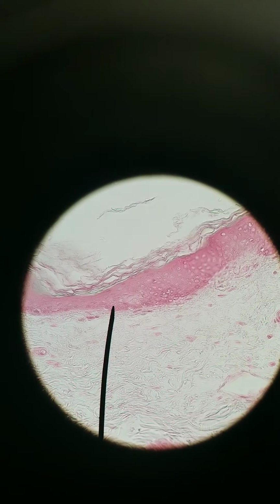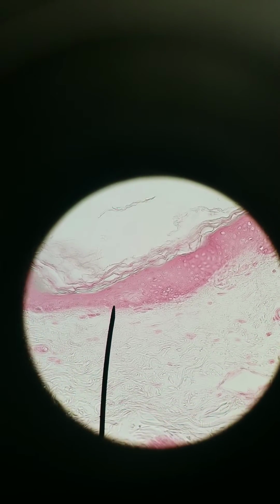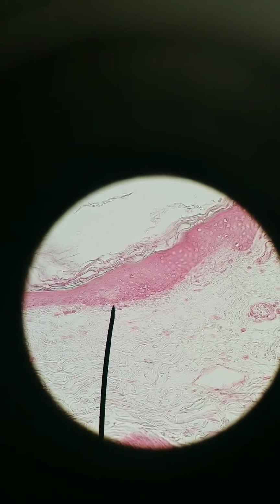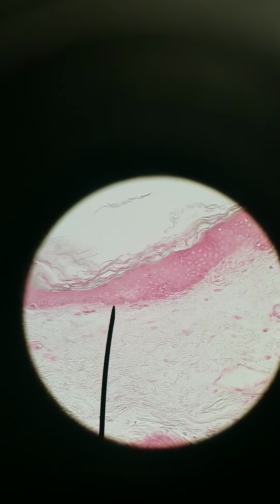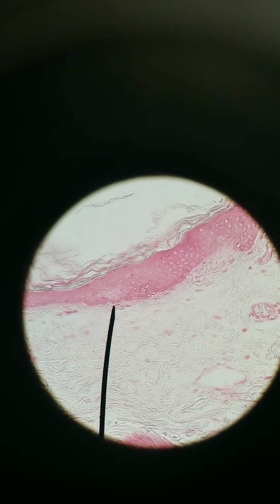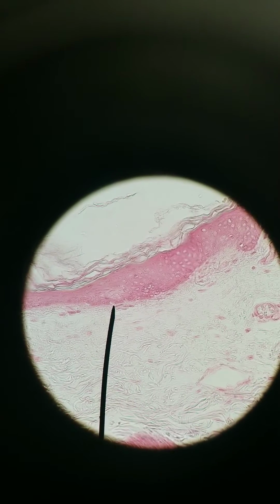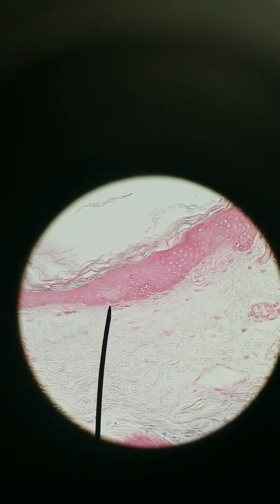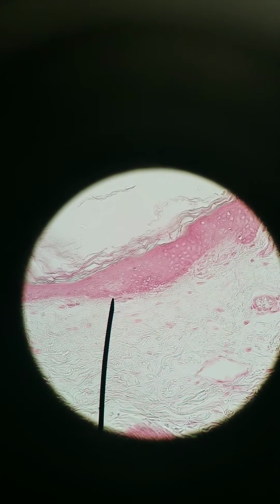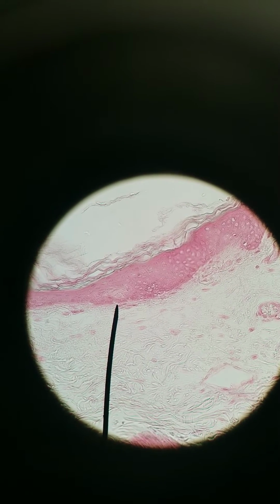Right now we're in thin skin. You can see the epidermis. There's stratum corneum, and then we get to stratum basale here. If you recall, we have one receptor in stratum basale, called a Merkel cell. I'm pointing at one potential Merkel cell right now. It's got a little white halo around it. It could actually be a melanocyte. Melanocytes and Merkel cells look really similar with this staining. So let's just say this might be a Merkel cell, possibly a melanocyte.